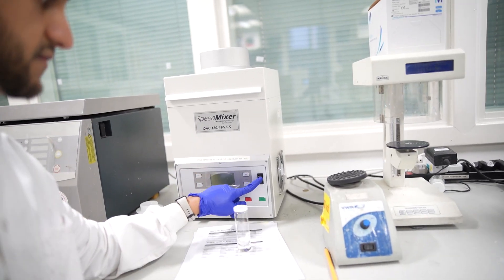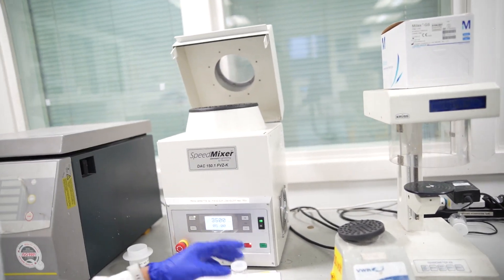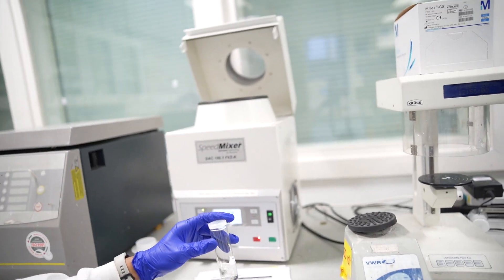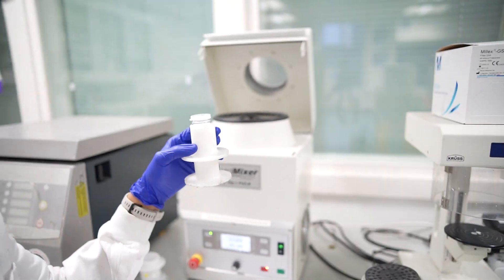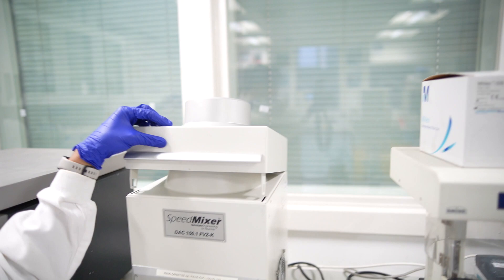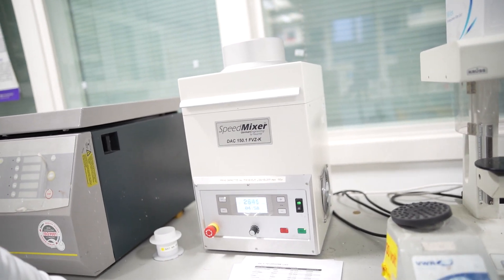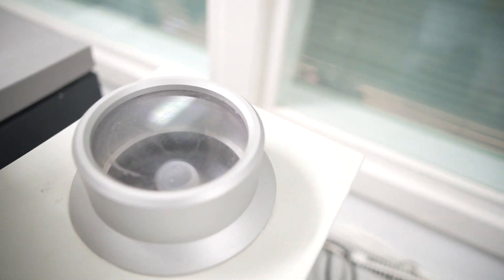This is our speed mixer. If I switch it on, it will make a loud noise as the fans ramp up. We can put our vial in here — plop it in, close the lid, press start. On the top we can see the pan is spinning very, very fast. That will help our solution dissolve so that we can spin it later on.